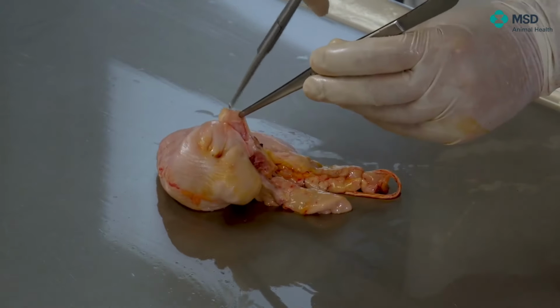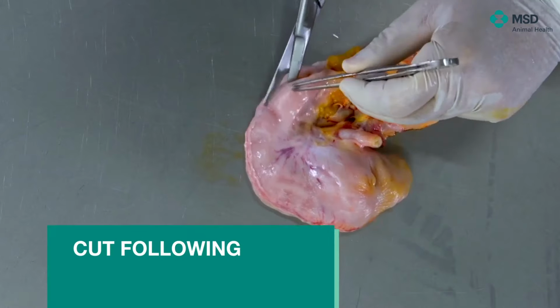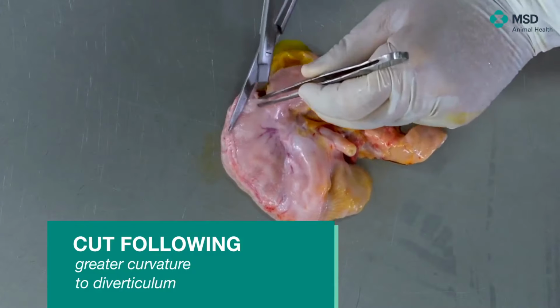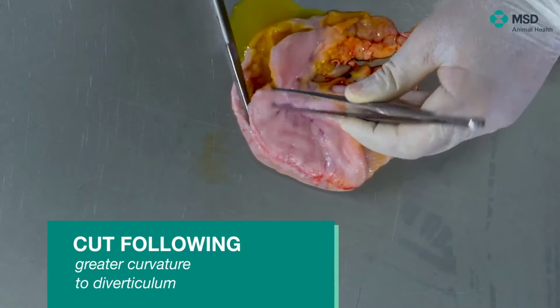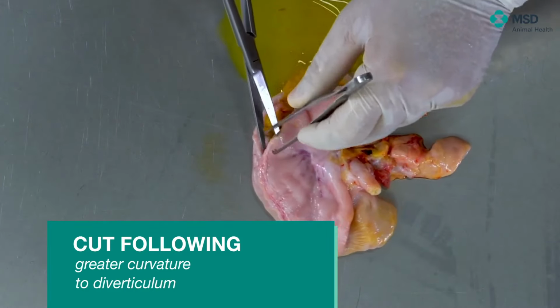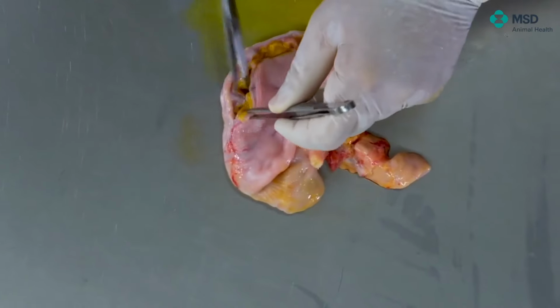So here we have the diverticulum, and then what we will do is just open, and the interesting part is to see the different areas of the stomach. As you can see, there's certainly a minimum amount of liquid.